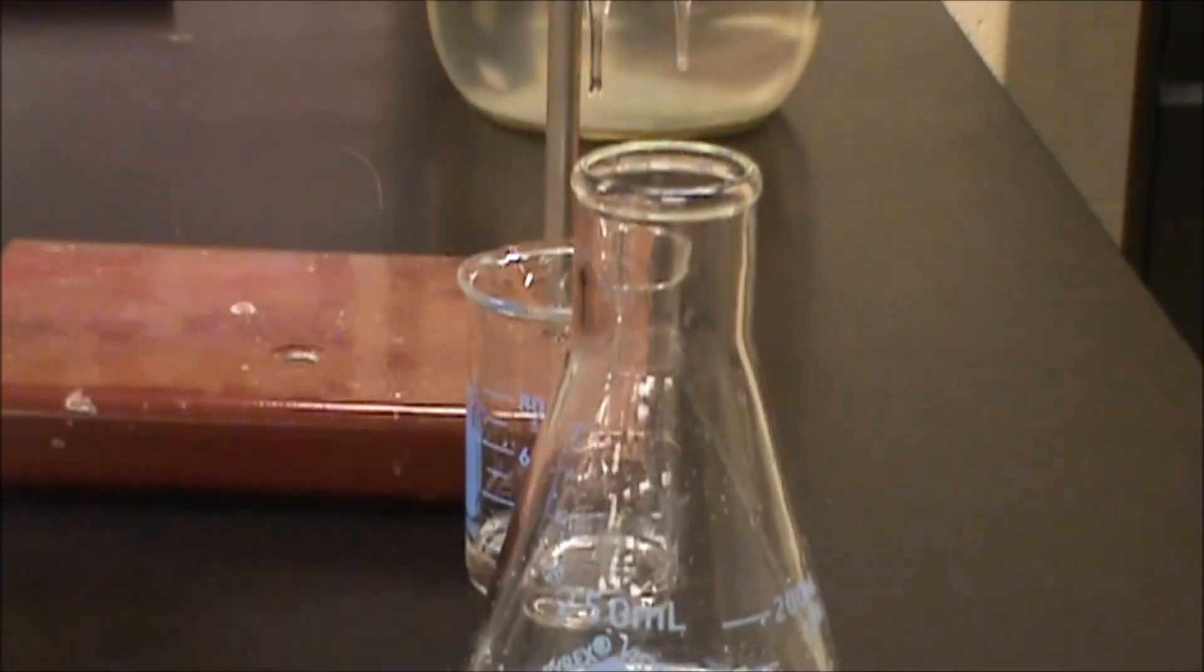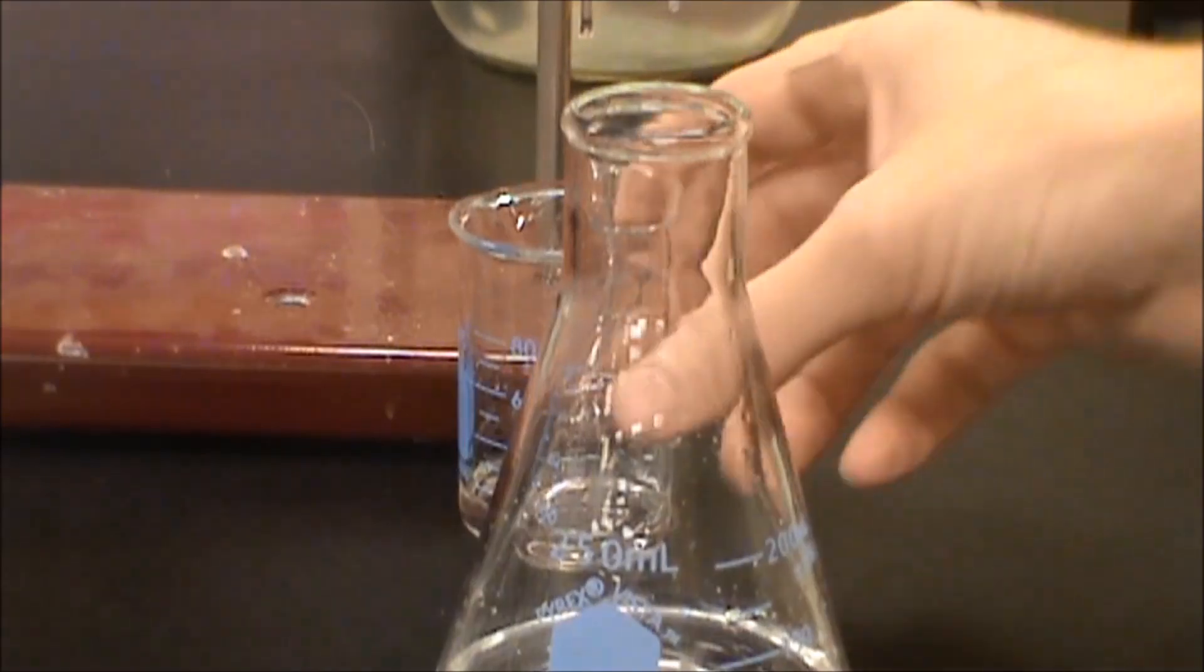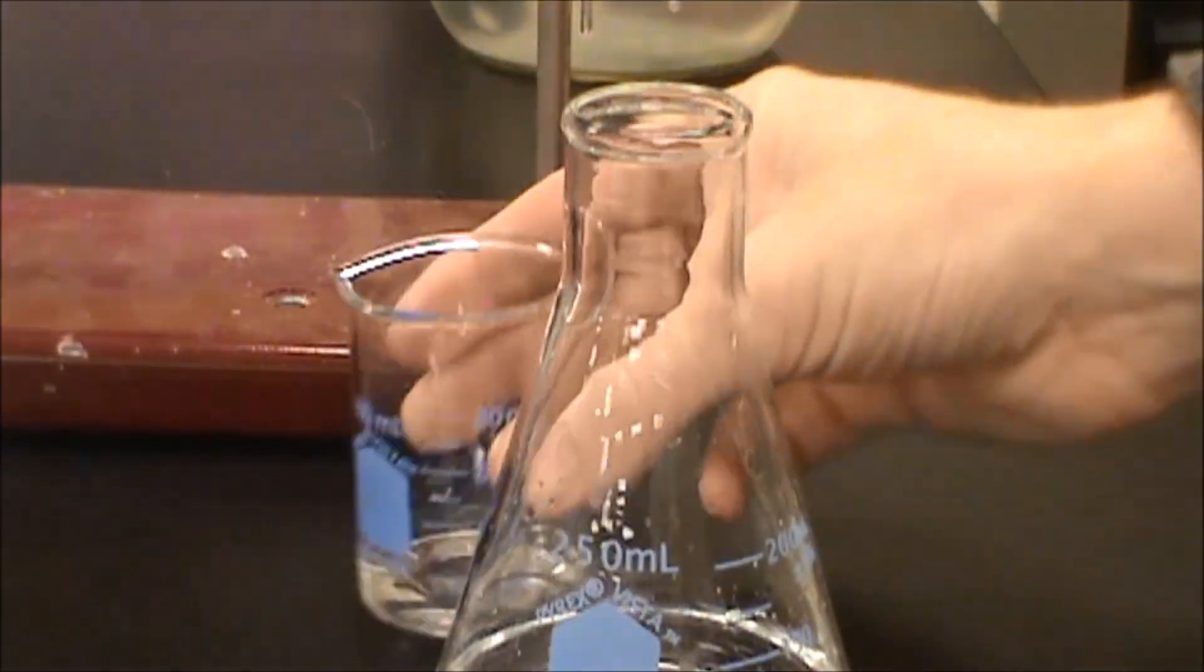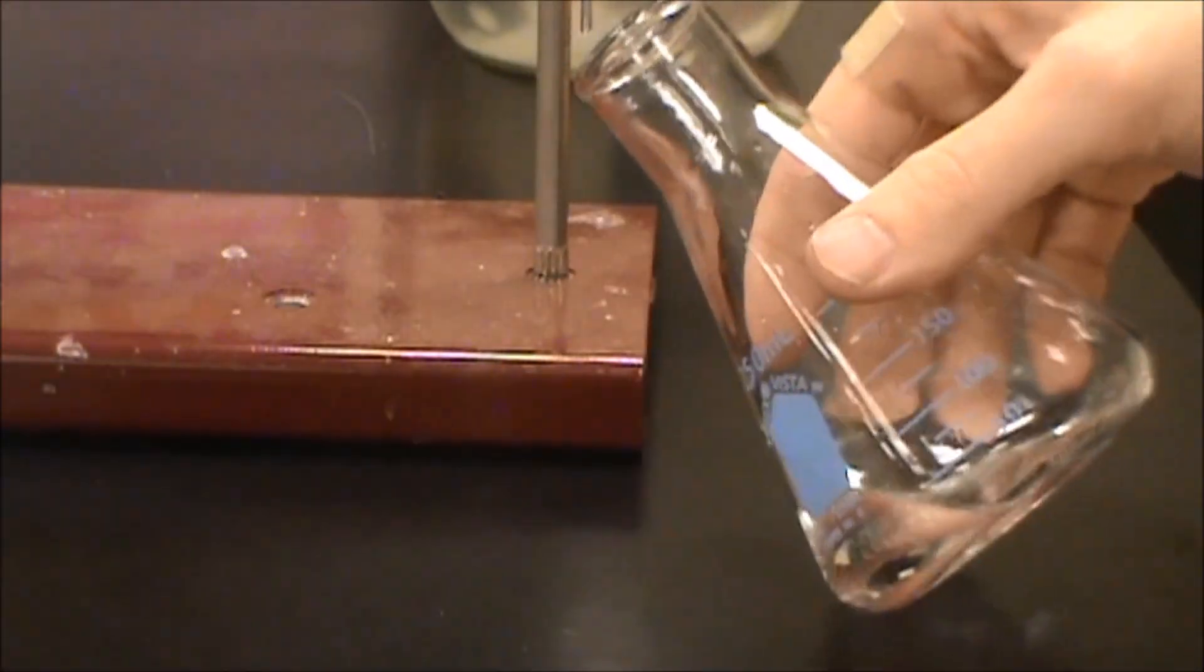Then we'll zoom back out. We are now ready to get rid of our waste and start with our titration.